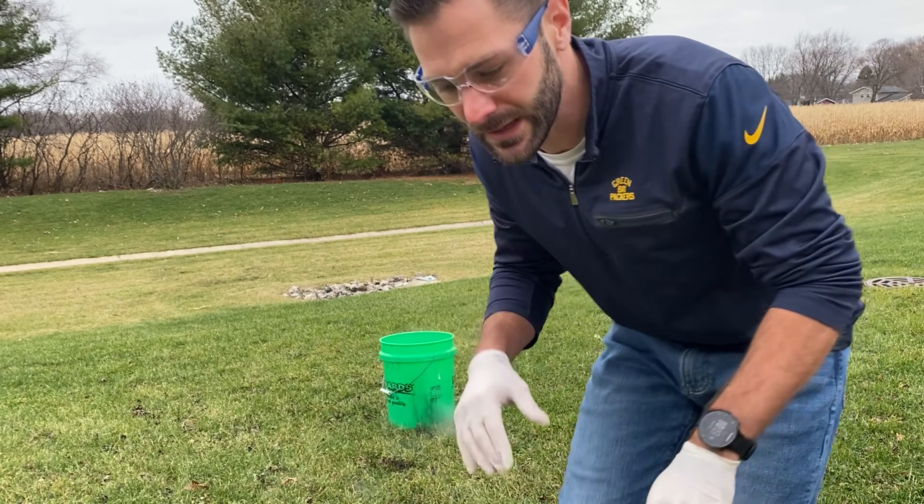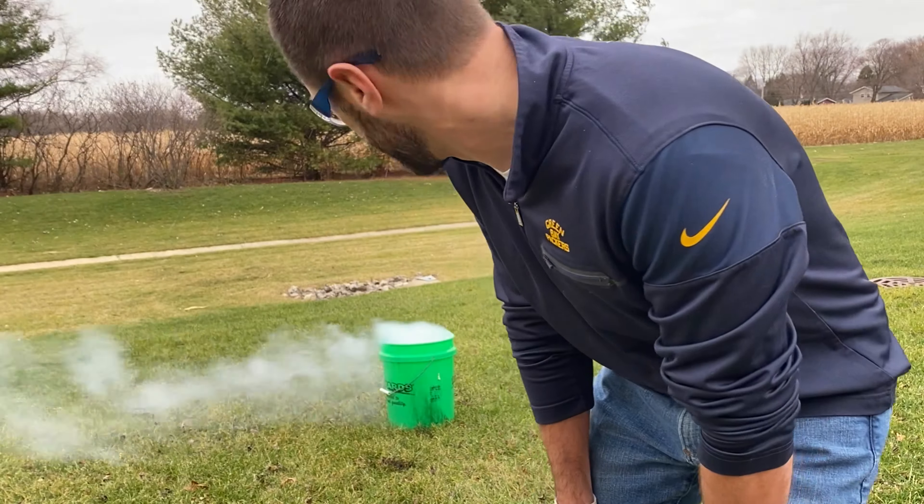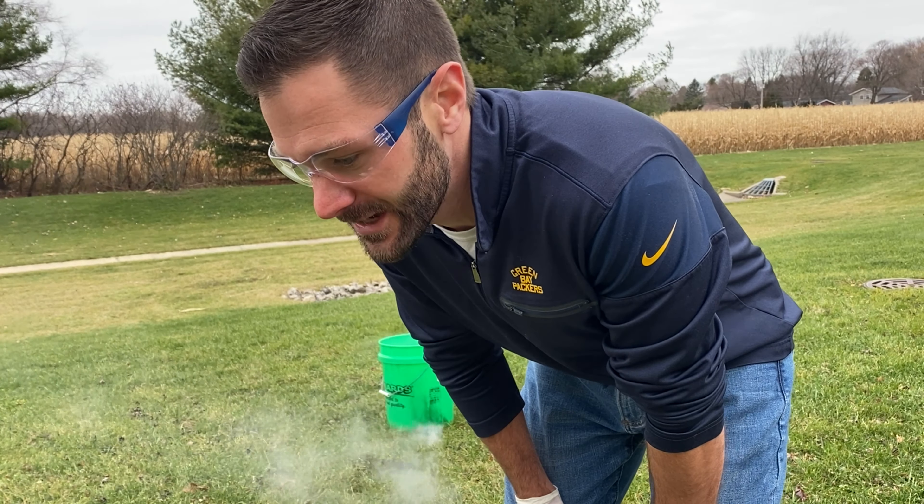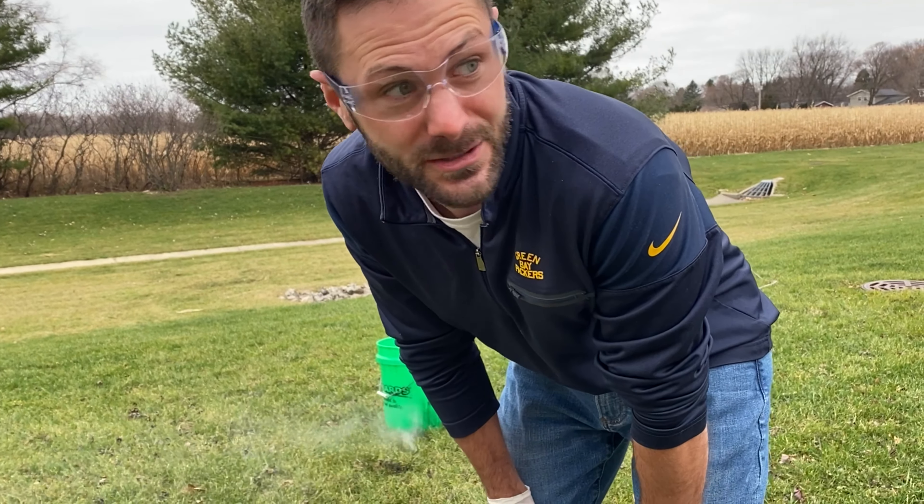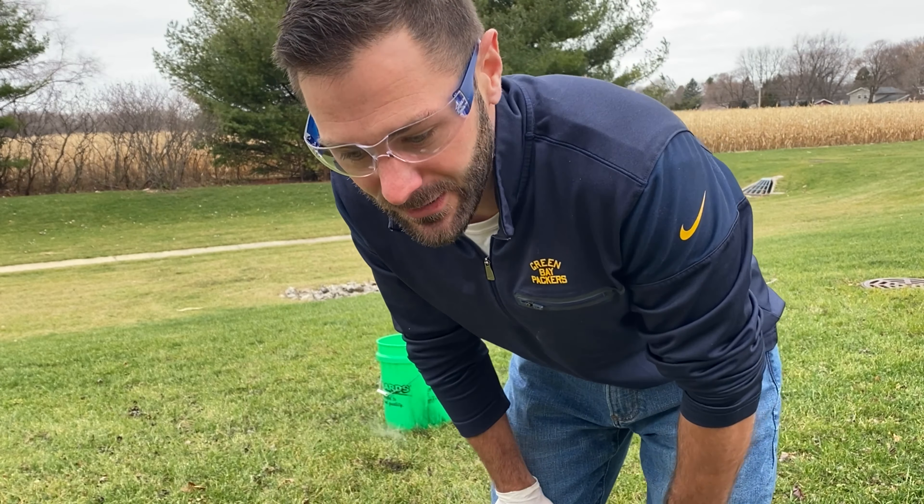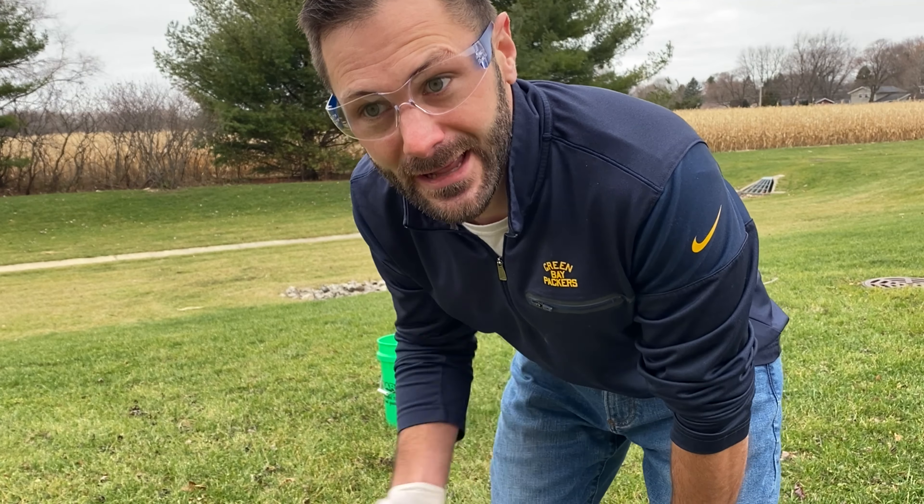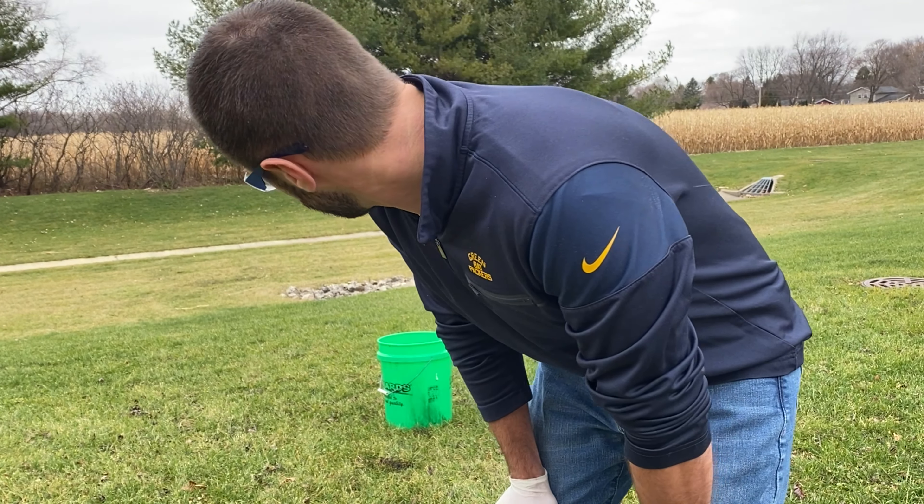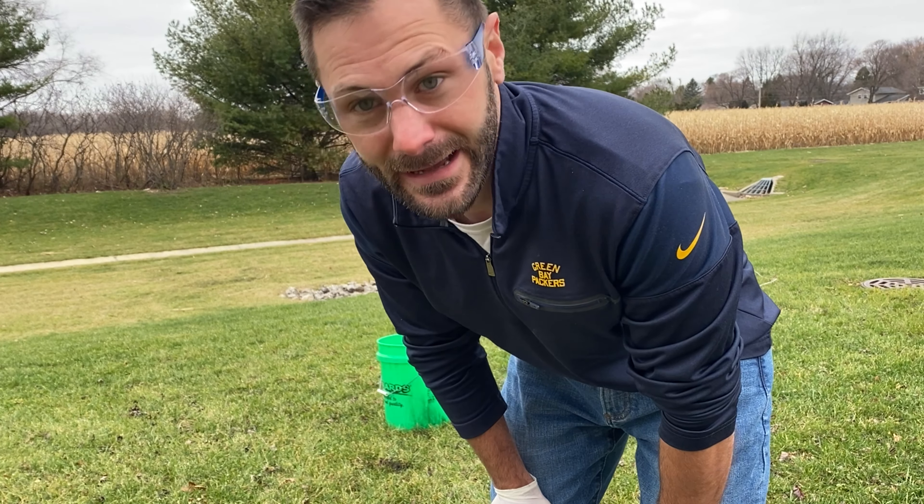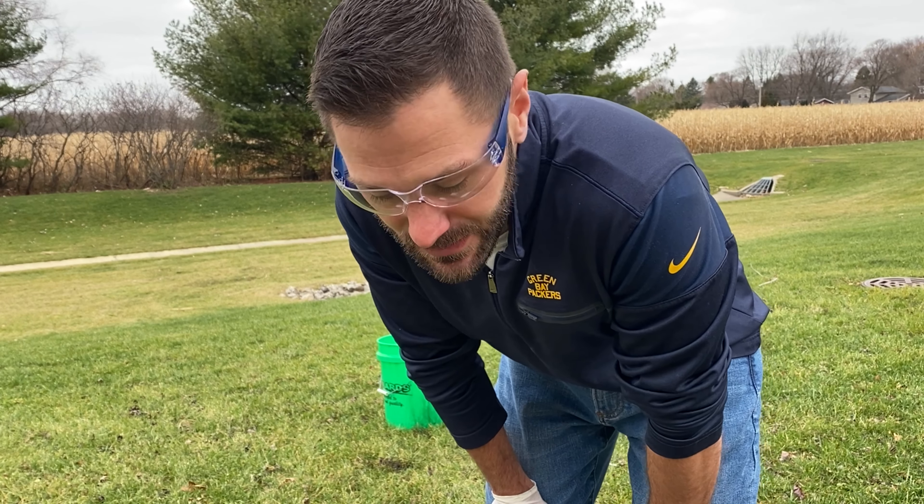Now, the reason you're seeing some fire and smoke there on the ground is because when it explodes, it happens so quickly, and this is not a scientific word here, but furiously, in some pieces, break apart off of there. It makes a very loud popping sound. In fact, it sounds a lot louder, I think because the bucket kind of amplifies that. It's down in a kind of a fixed volume space. The walls of the bucket kind of serve as an echo chamber, so a lot of that sound comes out the top. And the same reason all that smoke comes out the top, too.